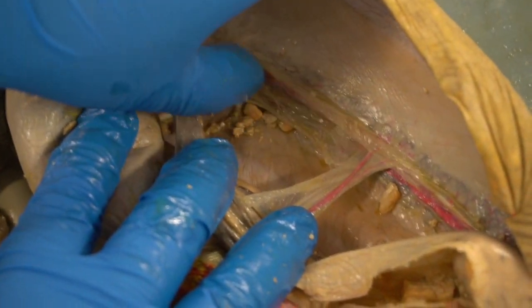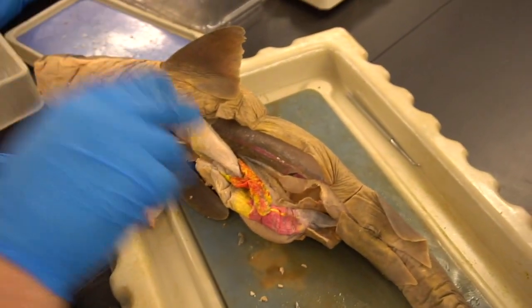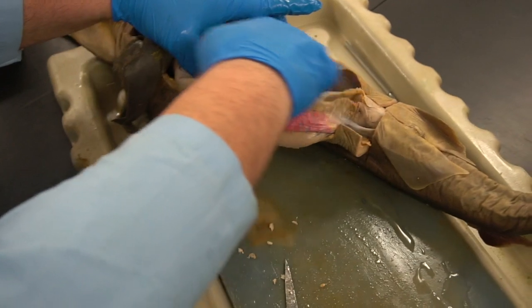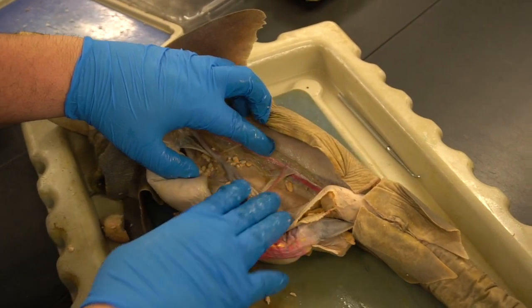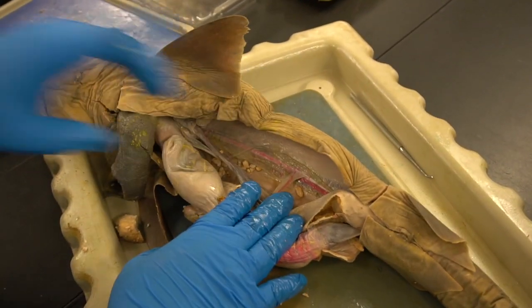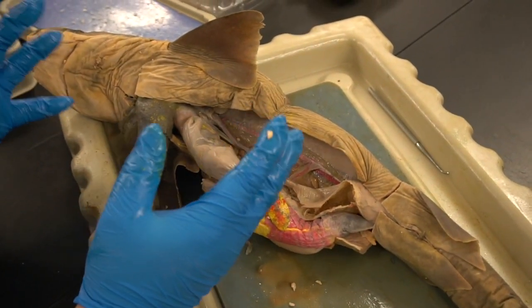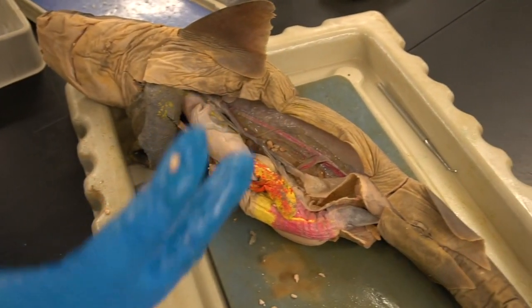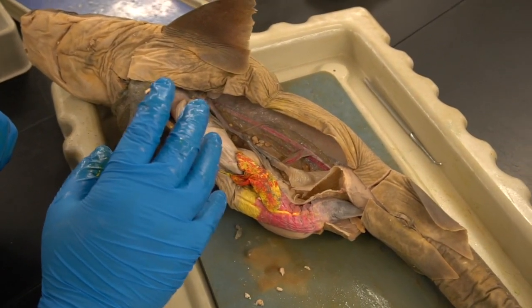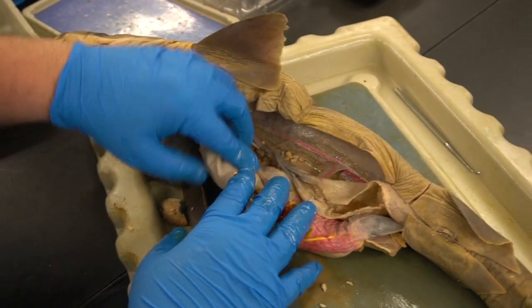Okay. One thing that isn't pictured super well, up at the ceiling or the dorsal aspect of the abdominal cavity, are the kidneys. They're kind of long. They travel along at the deepest location here, right near where the spine is. And you can see the dark tissue that's in there. That's the kidney. It's behind this peritoneal wall. Similarly, your kidneys sit outside your peritoneum. All right, so that's why sometimes it's dangerous if you get a kidney infection if it travels up, because it could then encapsulate your peritoneum and you can get a systemic infection very easily because the kidneys aren't as protected. But that's what you see up there.